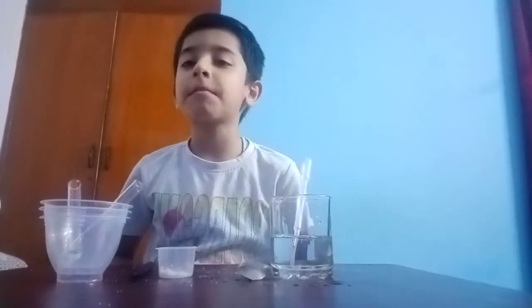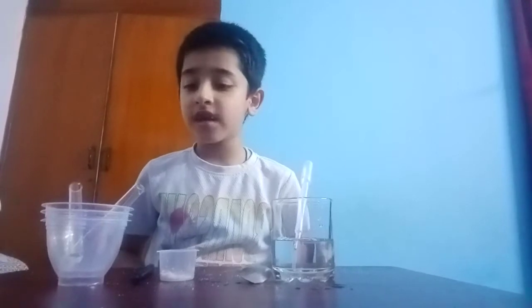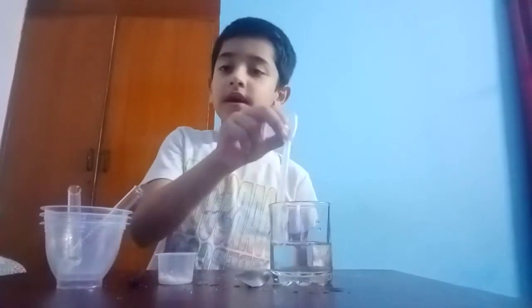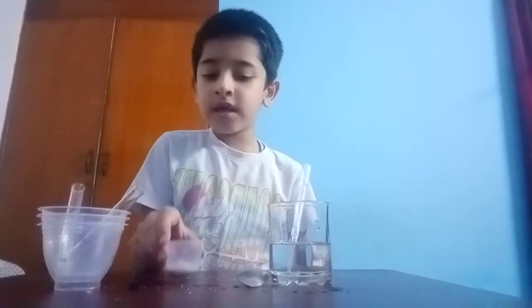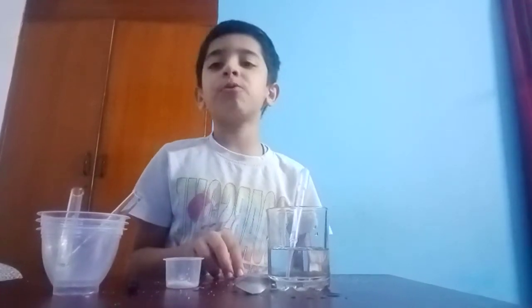My name is Aranj and today I am going to show you an experiment. For this experiment we need a pipette, test tube, marker, salt, and a spoon.